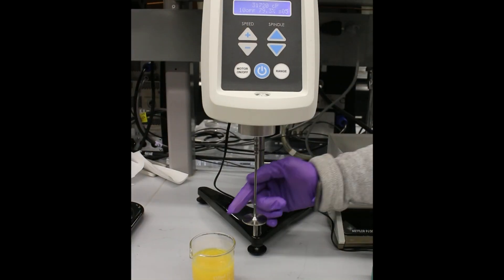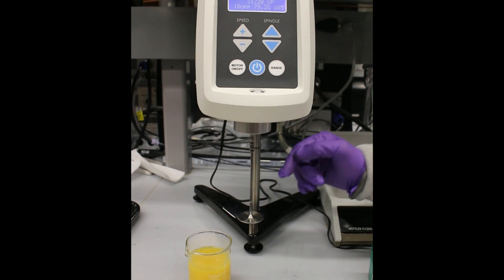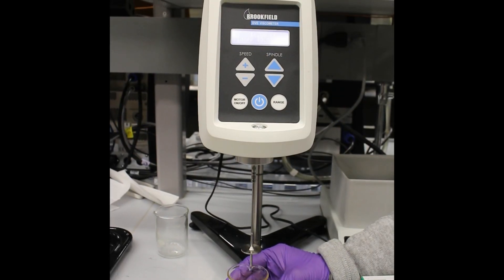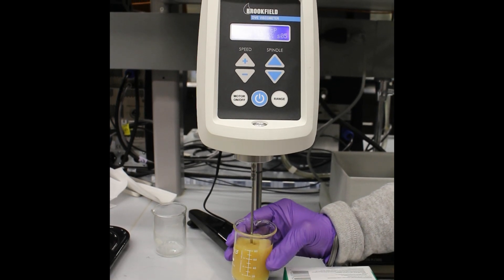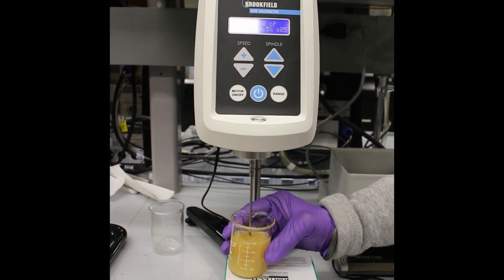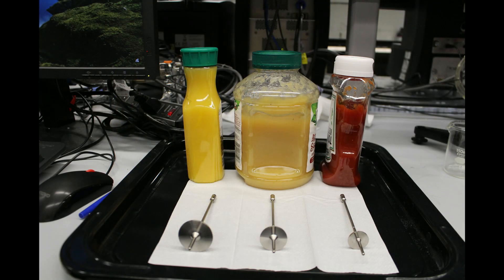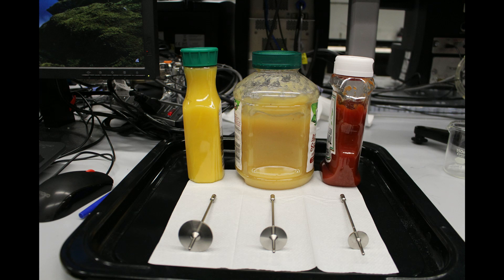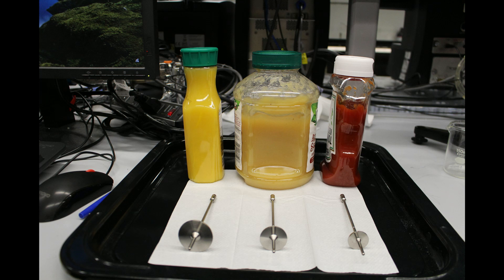Next we have the Brookfield viscometer. This is used to measure viscosity in fluid-like products. A spindle is placed in a beaker and the resistance on the spindle is used to determine the viscosity of the product. With the Brookfield the spindle is interchangeable — a larger spindle is used for lower viscosity foods like orange juice, and a small spindle is used for higher viscosity foods like yogurt.